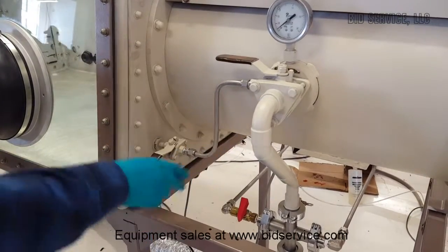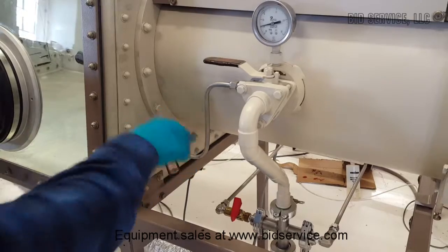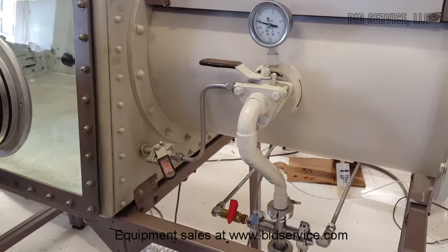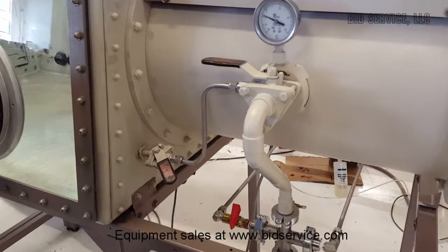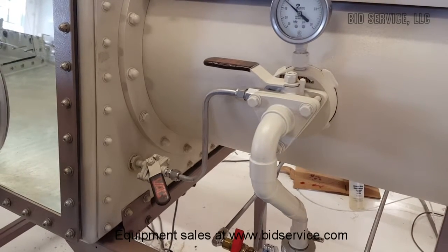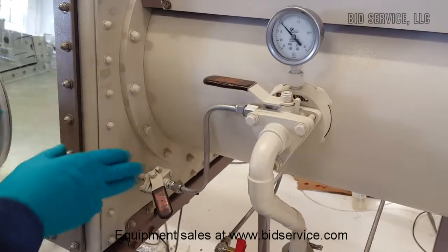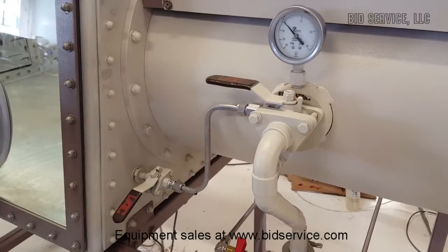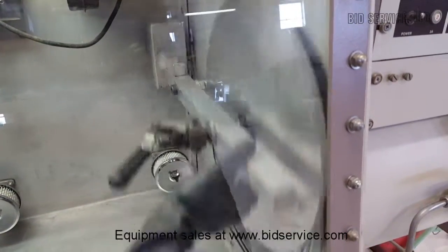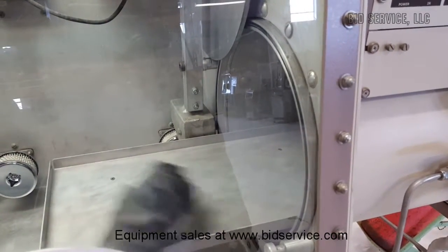I did my third evacuation and I'll backfill the antechamber. We're waiting for zero. Now the pressure should be equalized inside the box and the antechamber. I'll close this valve — it's best to close that. Using the glove you can come in here, open the door, similar to the outer door, and slide the work inside to unload it into your glove box.